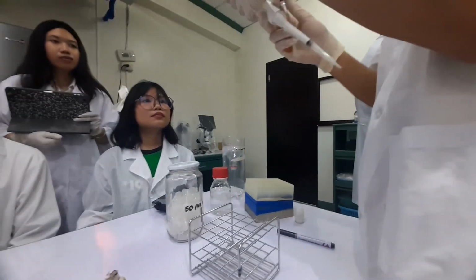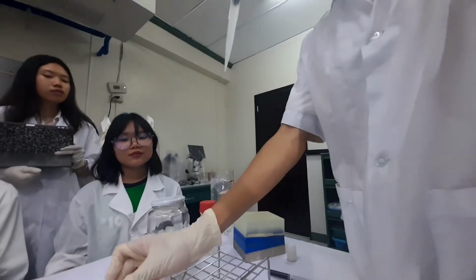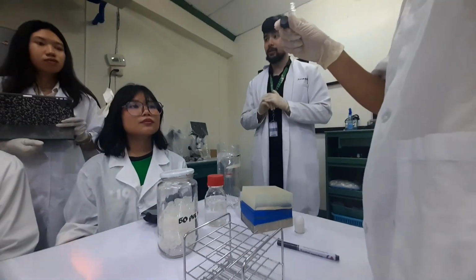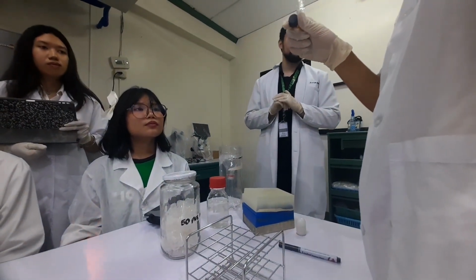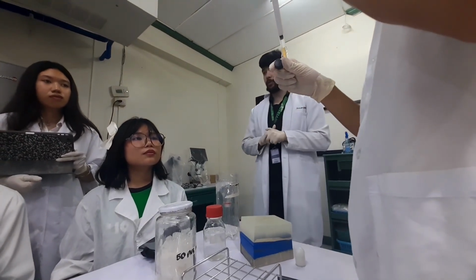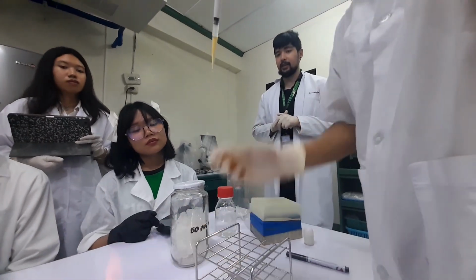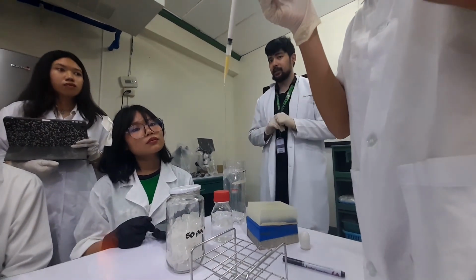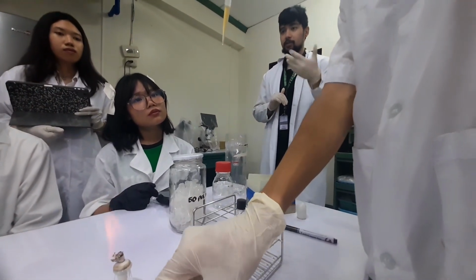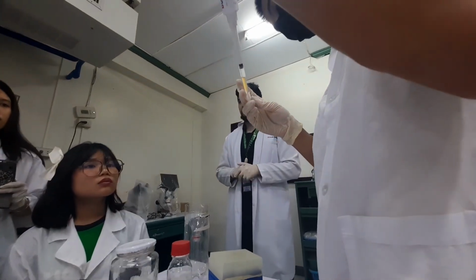For all of them, right? Yeah. So again, like I said, all he's going to do is he's going to centrifuge. You saw the centrifuge in the video, right? Spins. So he's going to centrifuge the tubes. And then after he's done centrifuging them, he's just going to take the liquid portion out and leave the pellets. You're going to work with one of the tubes because you're going to resuspend the pellet and do your DNA extraction. The other tubes we will freeze. Or actually we can leave them in the fridge, it'll be okay.